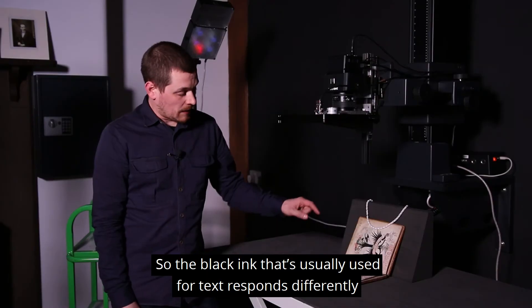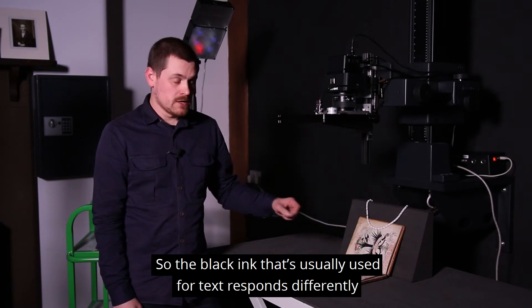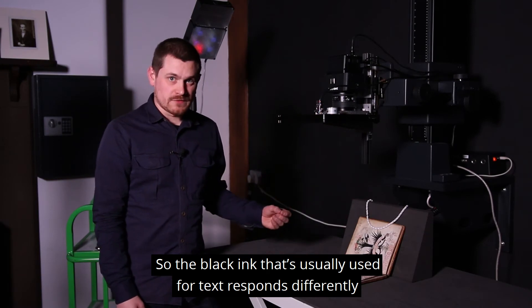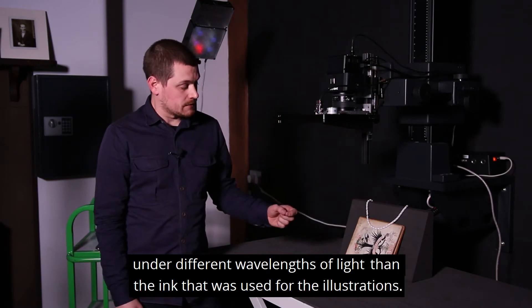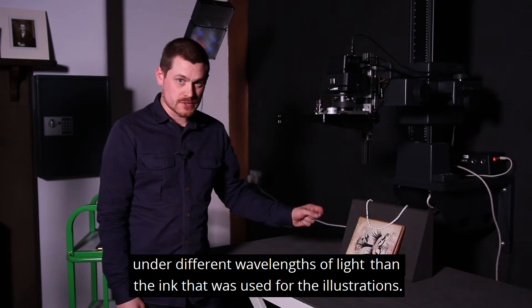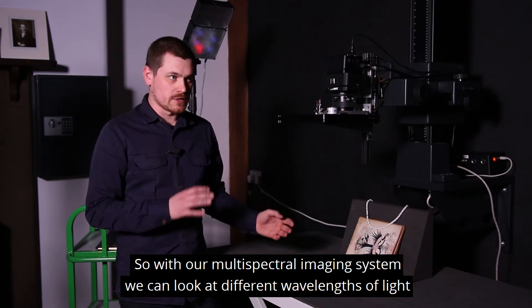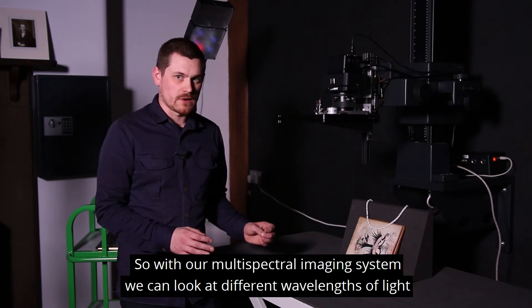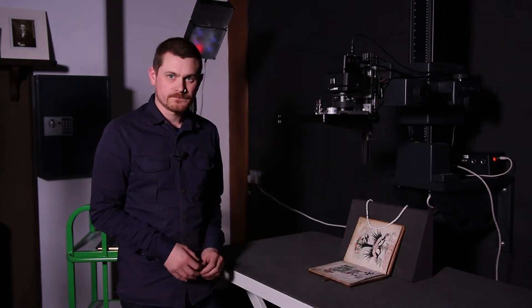The black ink that's usually used for text responds differently under different wavelengths of light than the ink that was used for the illustrations. With our multispectral imaging system we can look at different wavelengths of light and see those reactions happening.